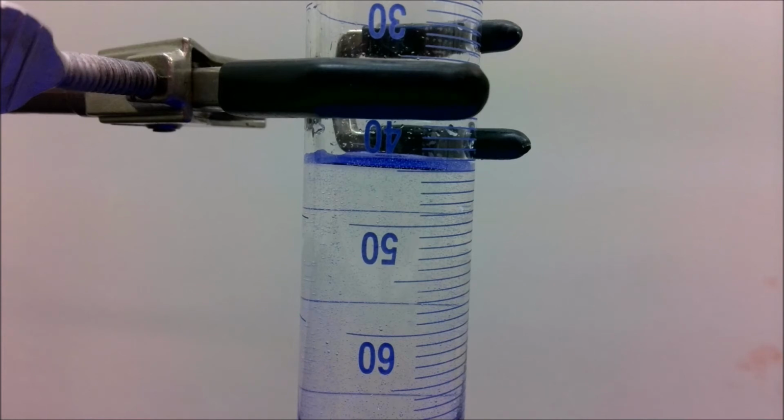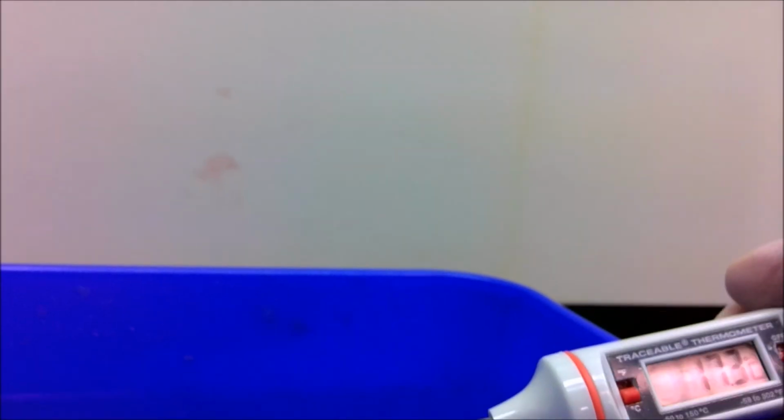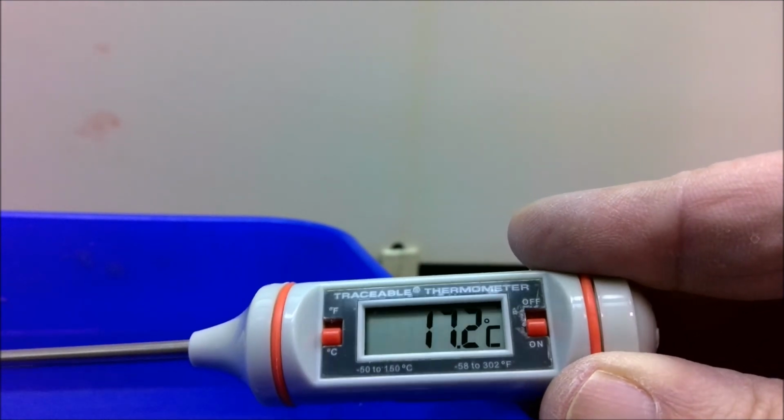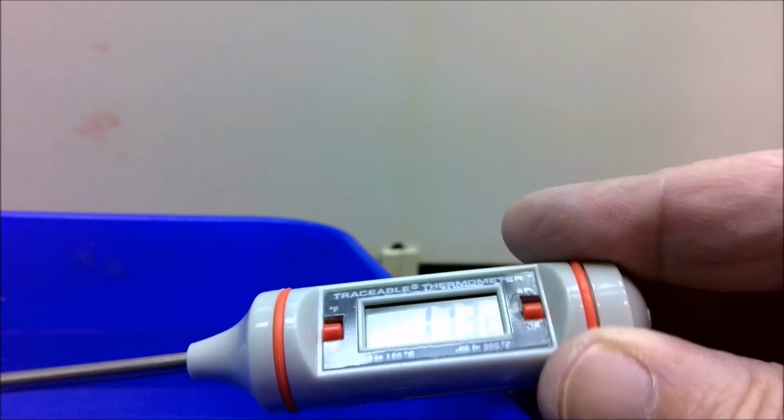Now that our reaction is complete, we can go ahead and start to get our final readings. Looking at the graduated cylinder, the final reading of volume and water in the graduated cylinder is approximately 45 milliliters. Our next measurement is temperature. We need to measure the temperature of our water trough, which we'll use as the temperature of our gas. Remember to use this temperature to get the vapor pressure of water using the appendix in the back of the book.